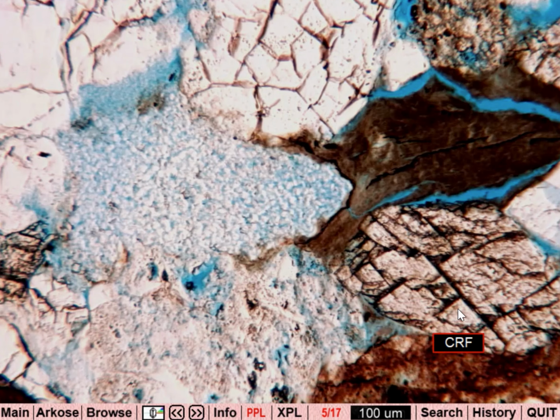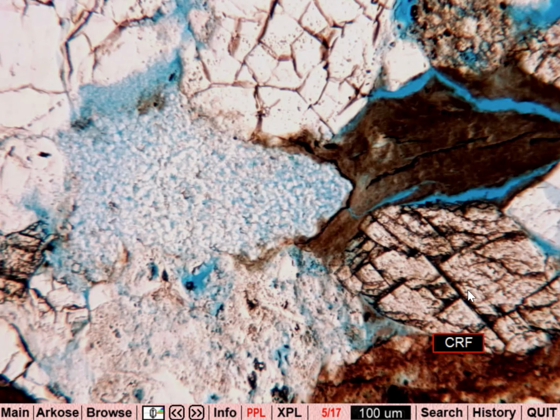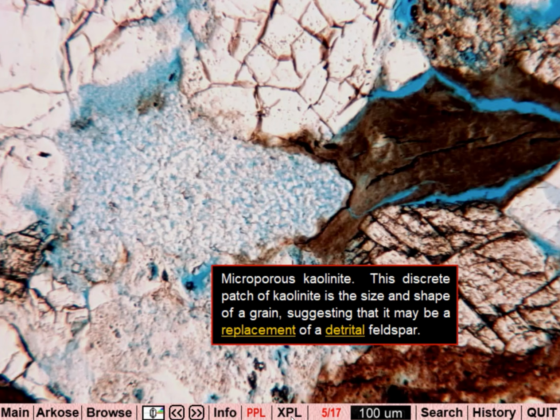CRF, I think, is a carbonate rock fragment, so there's some sort of limestone or marble contributing here, and then a lithic mudstone clast. This is quite an interesting arkose. And again, the kaolinite is the new thing here.